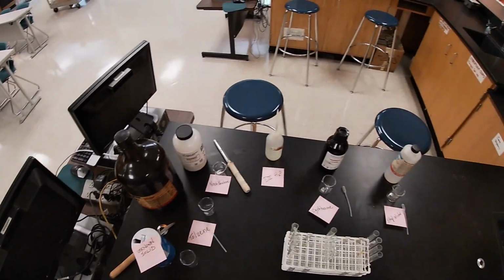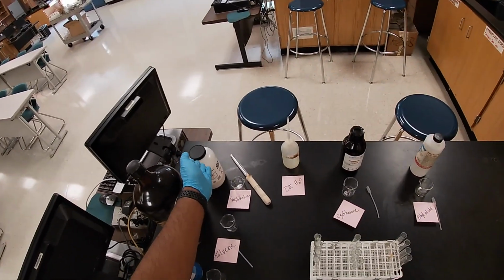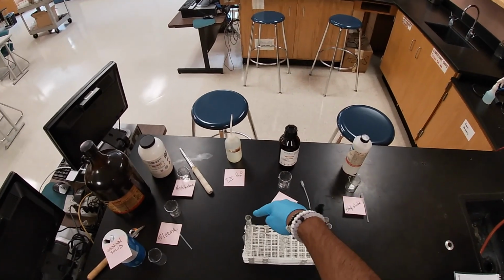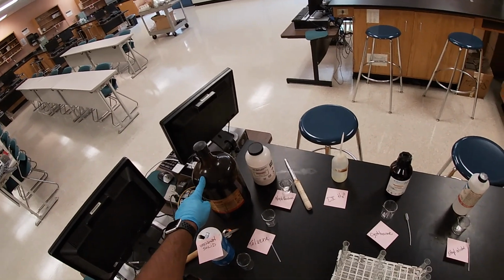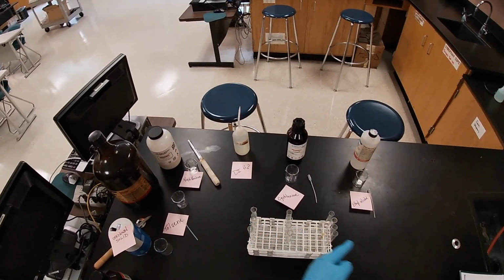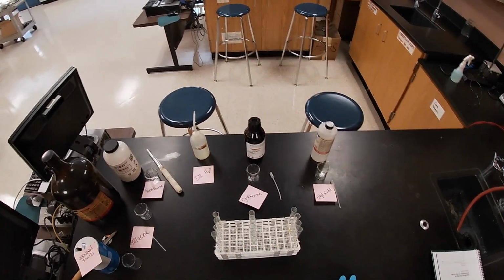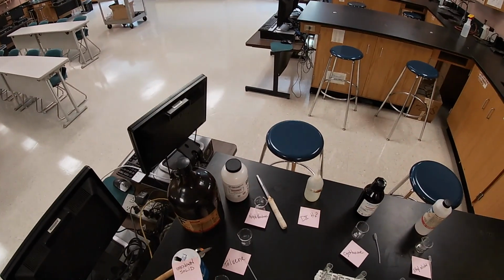And then of course I'm going to be scooping the solids in. Here we have the test tubes, and hopefully you can notice that we're going to fill this whole row of test tubes with naphthalene. And then here we're going to fill the second row with toluene, and then of course the third row with the unknown solid, and then lastly the unknown liquid with the last row. And we're going to determine the solubility.